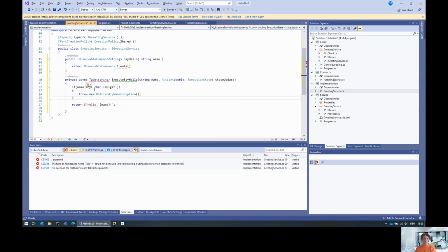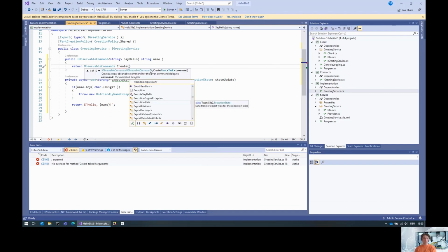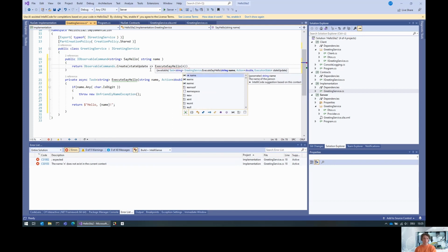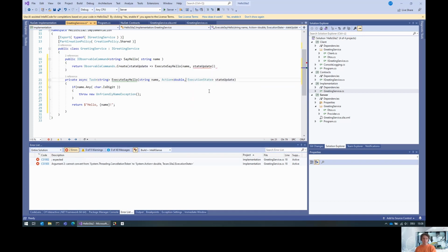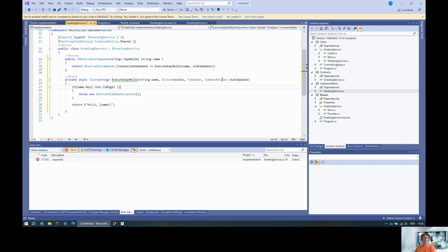And okay, I need to import the tasks. And we can execute say hello with the name from the parameter and the state update. Okay, double, time span, and command. Yeah. Okay. And we can now use the state update action to report state updates.